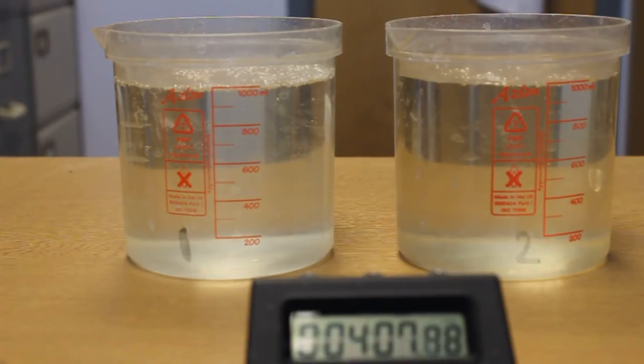Now the time approaches 4 minutes, the Aquatabs tablets have completely dissolved in the water and now the chlorine will react with whatever organic materials are in the water. We will leave it now until the hour mark and then we will test it for the concentration of chlorine residual.